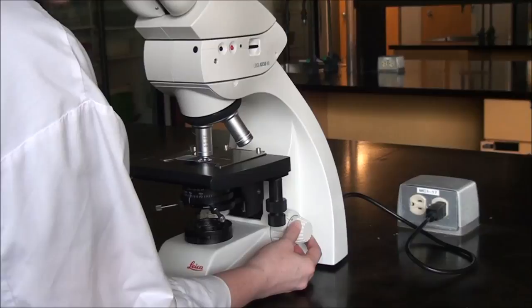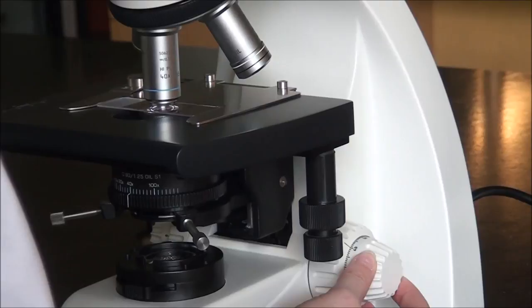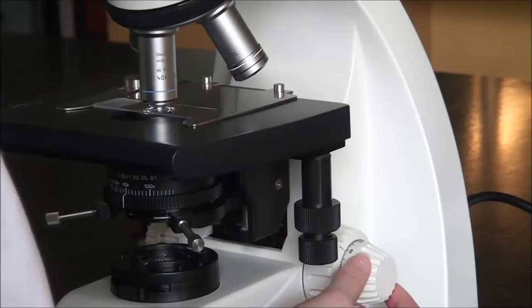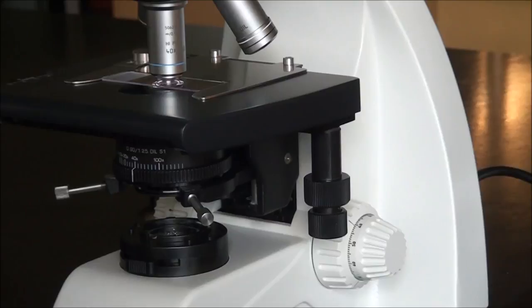Make teeny tiny fine adjustments, usually turning the knob to lower the stage slightly, and once again you have cells in your field of view. Something that's really important is to try to ensure you always have a high cell density in the middle of your field of view because as you change objectives, your field of view gets smaller. Now we're ready for oil immersion.